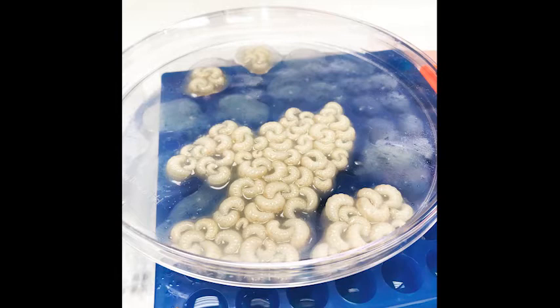And here's a figure from a paper that I published some years ago where we were rearing larvae in the lab, not on worker diet, but on a queen diet. And so we see on the right hand a control. This is a queen we reared completely in the lab. This bee never, after she was grafted out in the first day after she hatched, was never touched by another bee again. She was reared completely by me in a petri dish. And so she emerged looking obviously like a queen.